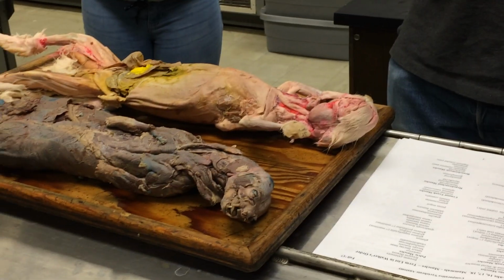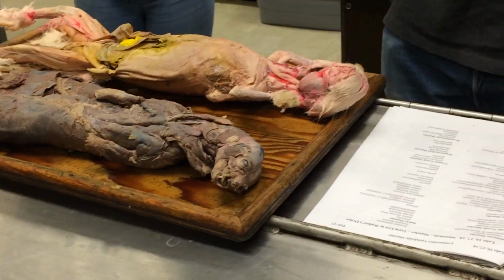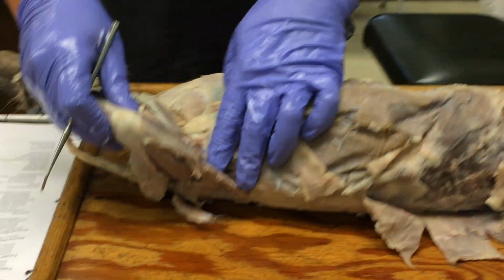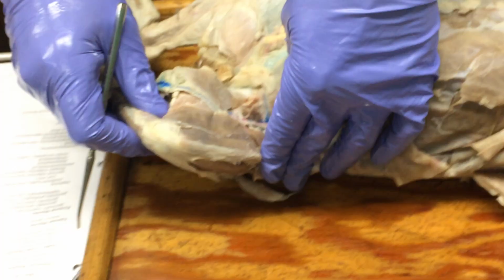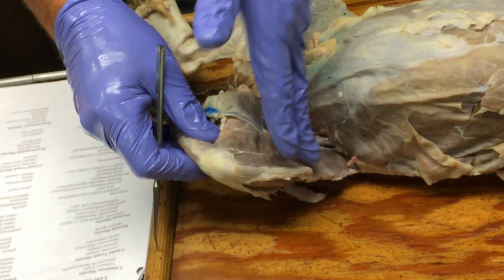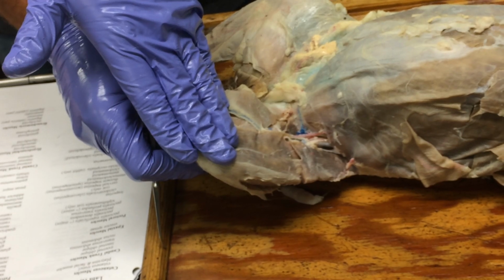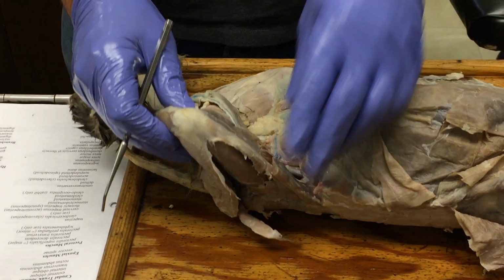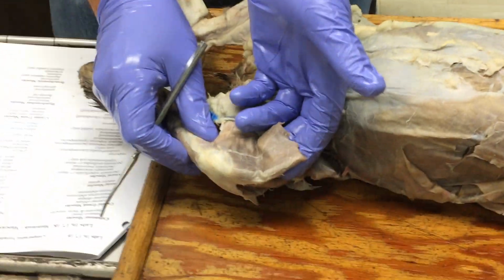Probably the most different between the rabbit and the two carnivores. So in a cat, and the mink is similar, the sartorius is this kind of big muscle that lies along the front of the thigh and then comes down along the front and then the inner surface of the thigh here. So it's kind of crossing the front of the thigh. And that's this thing here and here. You guys see that okay?